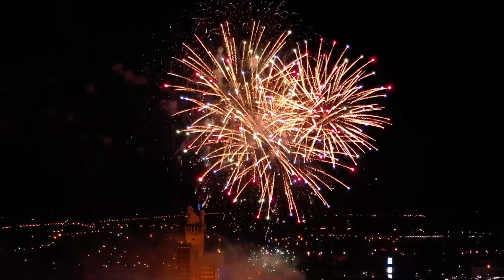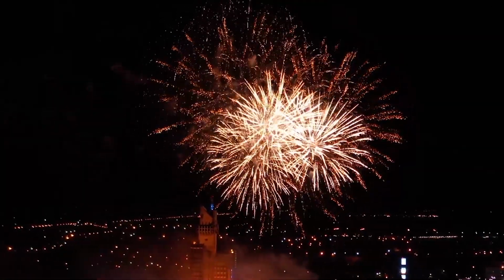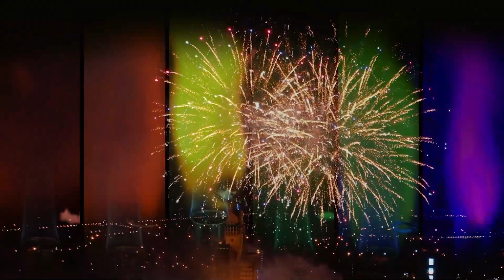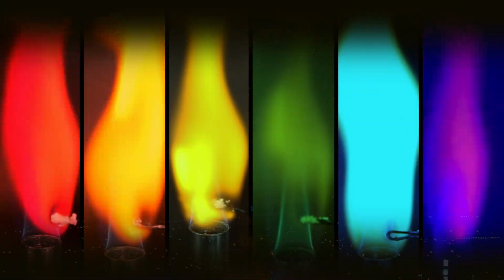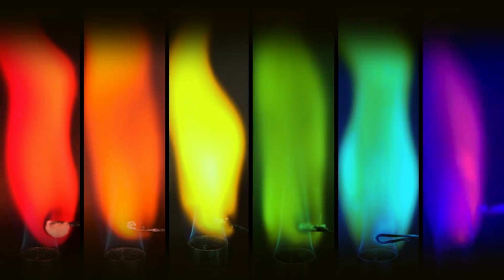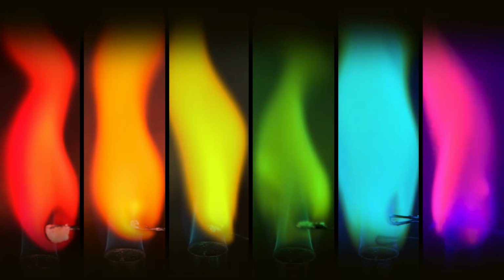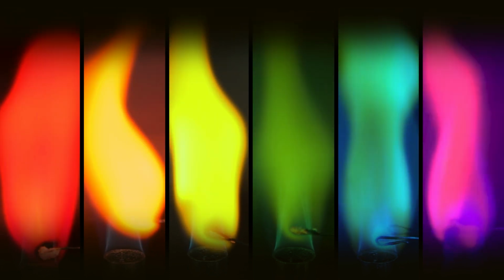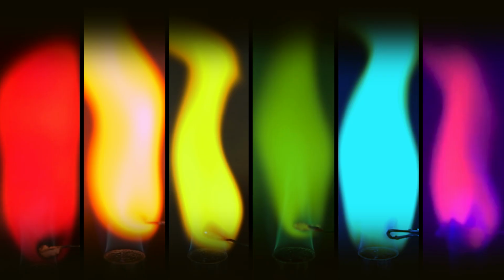To uncover the mysteries of the fireworks, we will employ a technique known as the flame test. The flame test is a technique that involves heating metal cations in a flame and observing the color they produce to identify a particular metal cation. The flame test enables qualitative identification because different metal cations produce distinct flame colors. I'll now guide you through the steps to perform the flame test safely in your laboratory.